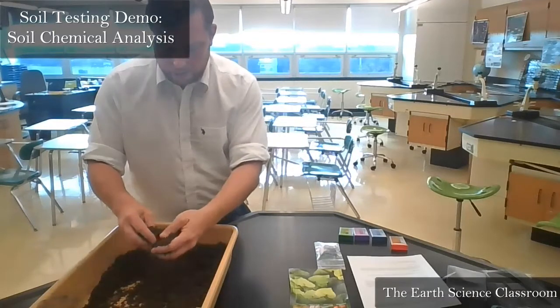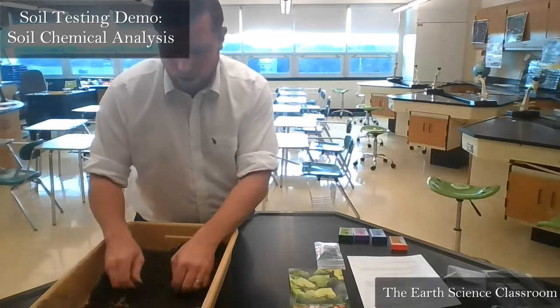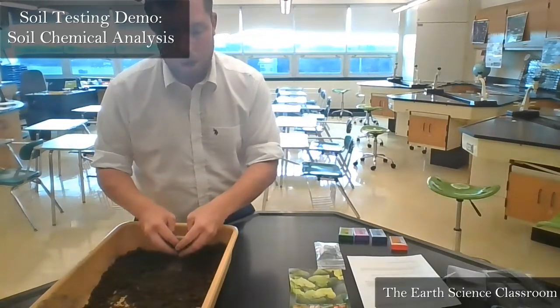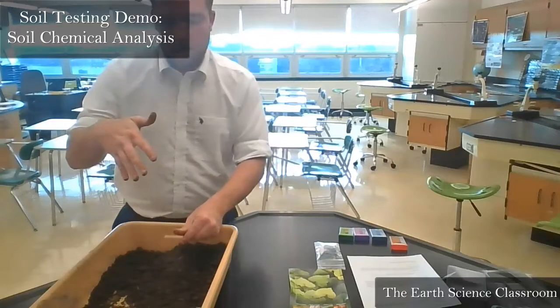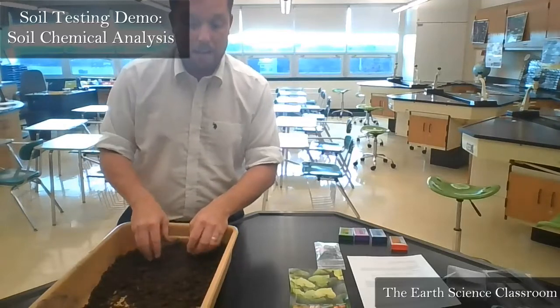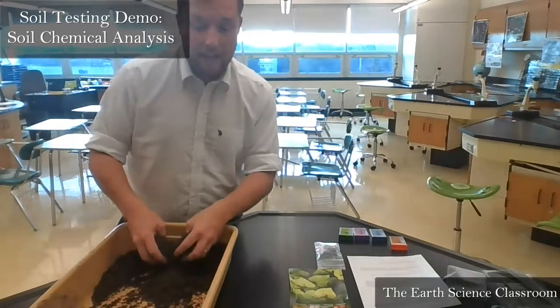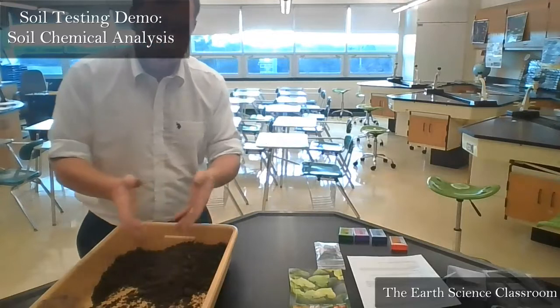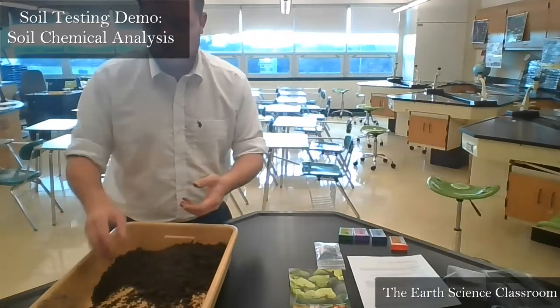Now, the chemical analysis involves 4 things, starting with looking at pH. pH is the measure of the amount of hydrogen ions in the soil. Basically, if there is a high amount, it will be acidic. If there's a low amount, it will be a base or alkali. Certain plants like more acidic soil, with more hydrogen ions, and some plants like more alkali or base soil. So we test the soil to see what kind of plants would like to grow in it.